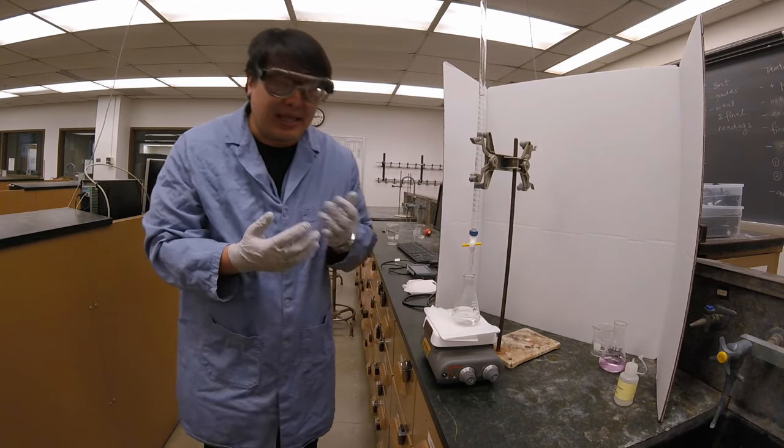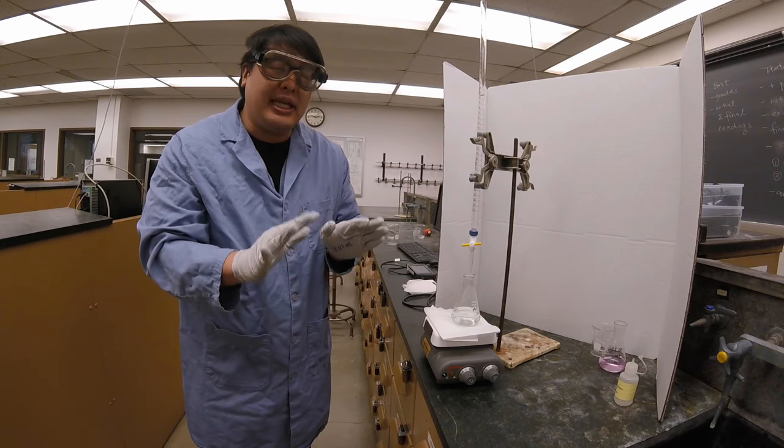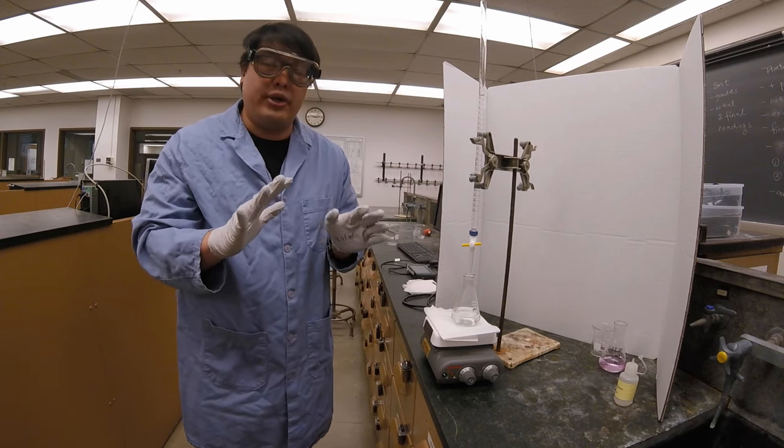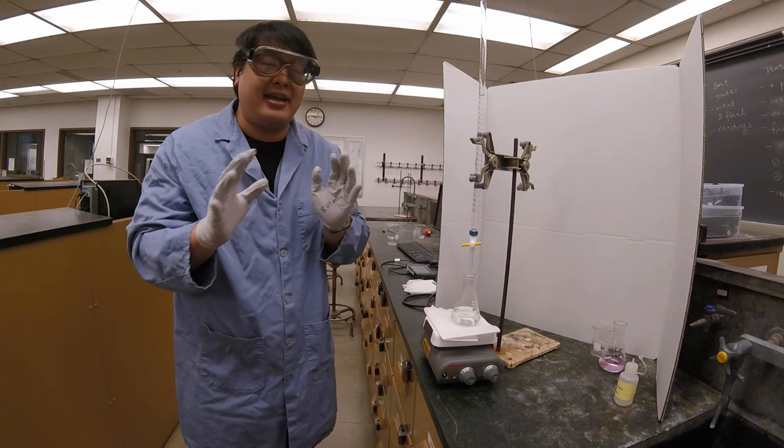I know it should be a bit less than 27 milliliters, and I'm going to try to get a really light pink color because that's how we know we have very similar amounts of both base and acid.